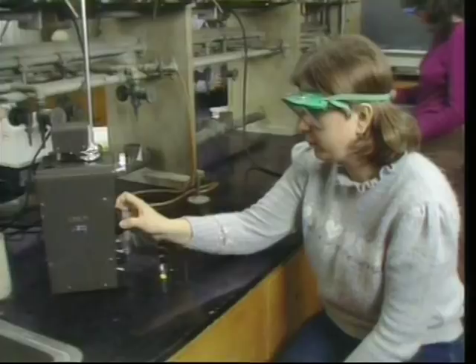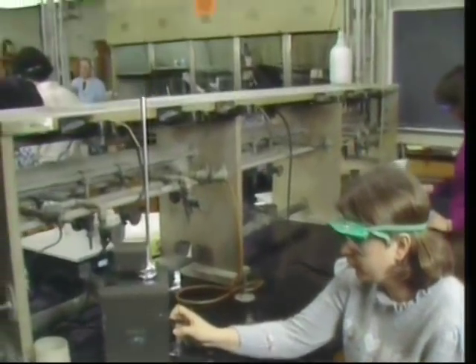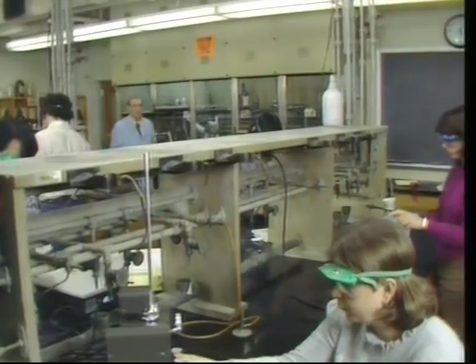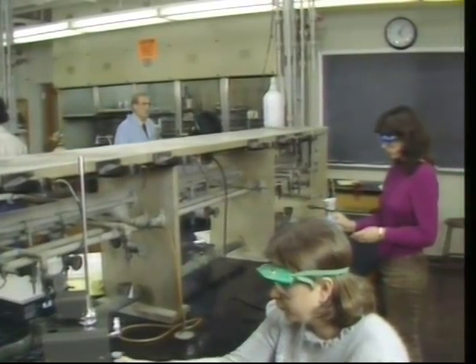A chemistry laboratory, like any environment, contains hazards. However, chemistry, like any other activity, can be carried out safely if proper attention is given to following the right procedures. You'll be working with apparatus and in situations that for the most part will be new to you. You'll be working with a variety of materials.